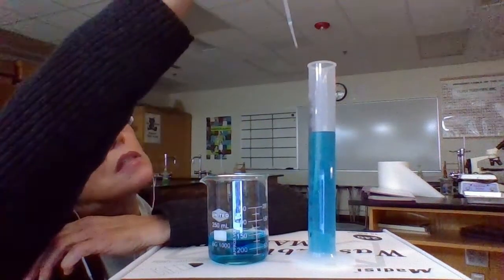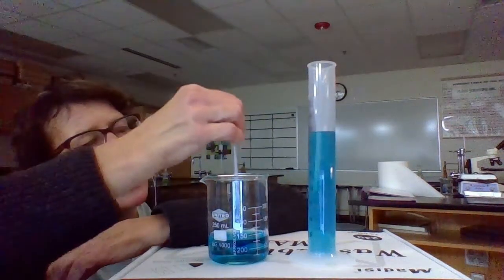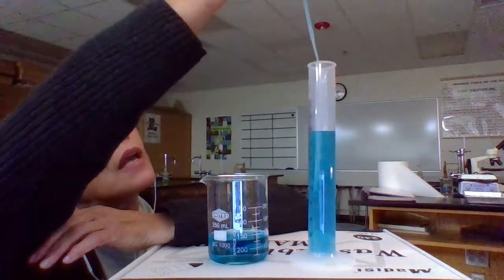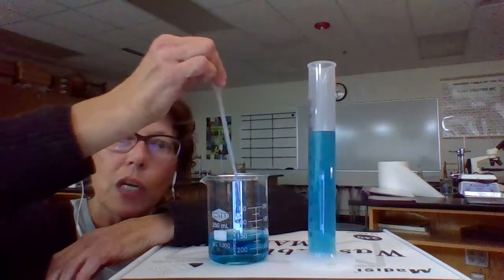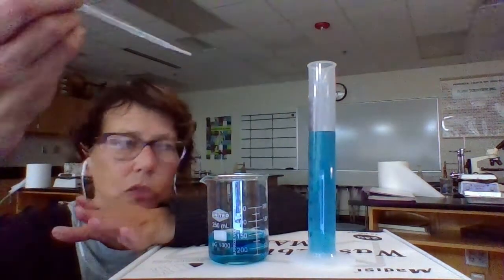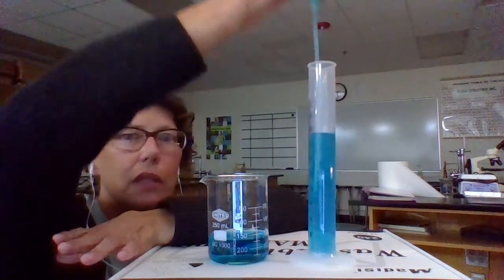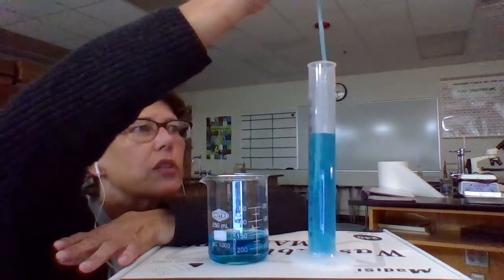And it's always good to stop and let the water settle, because when you add water to it, it starts rippling. And then you can see if you need a little more, you can add it. And by the way, if you get too much in here, it'll only be a little too much. So you can use this to get out a little bit of the liquid if you went over.